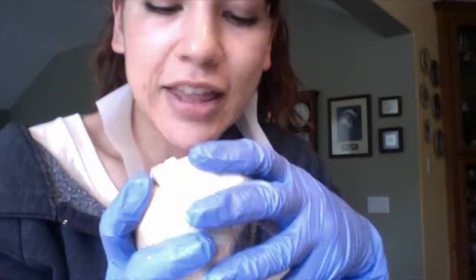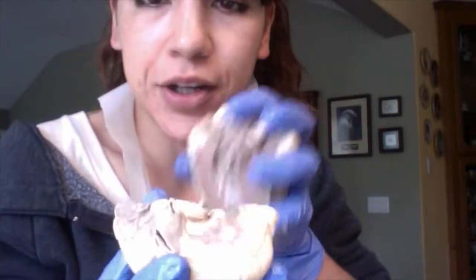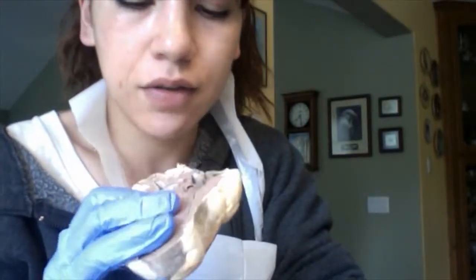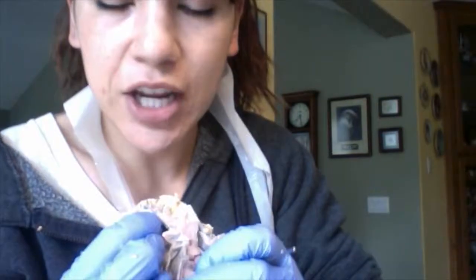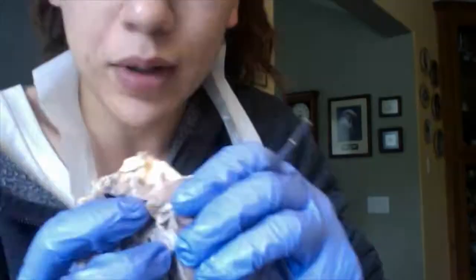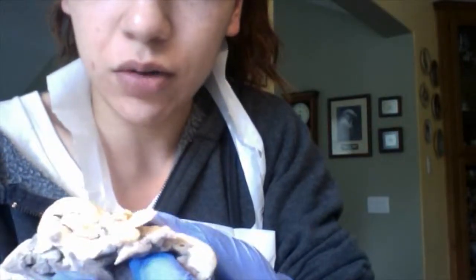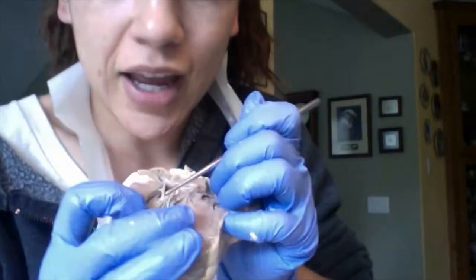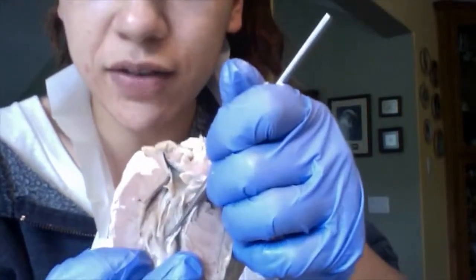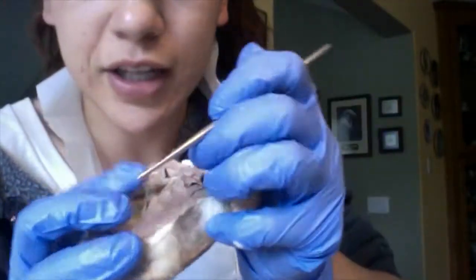Now we're going to look at the internal structures of the heart. I have cut the heart in half into an anterior and a posterior half, but for this part we will focus on the posterior half. So again, I have the left atrium here, and this is the auricle, which would expand and allow for greater blood volume in the atrium. And here is the right auricle as well, which again expands. I have trabeculae carneae, which are these stringy parts of the muscle here. The papillary muscle and the chordae tendineae are inferior to that.